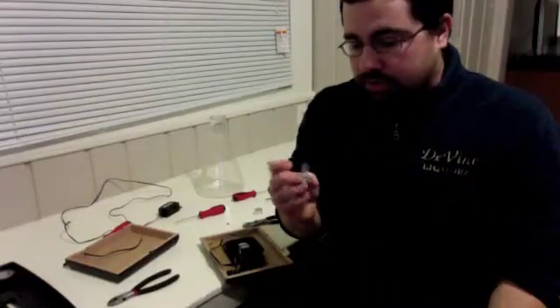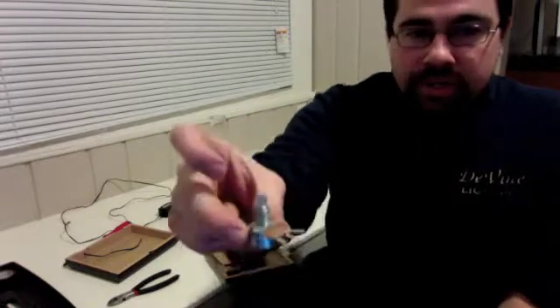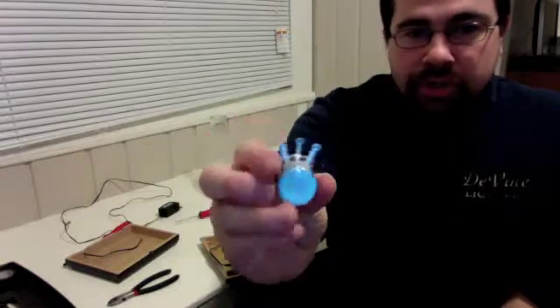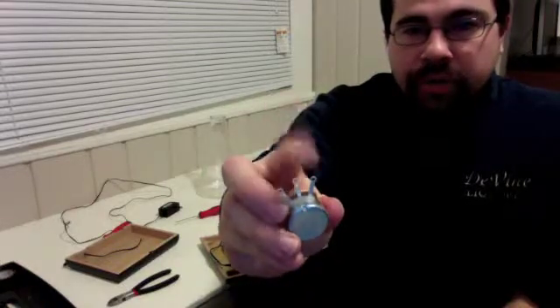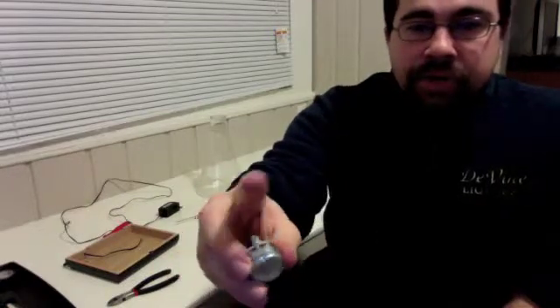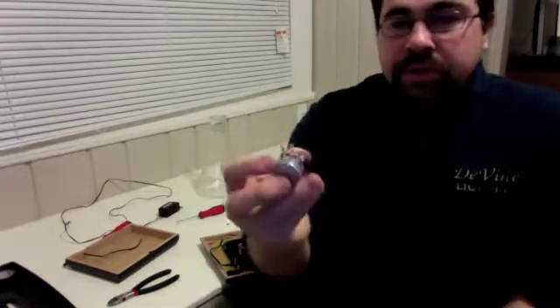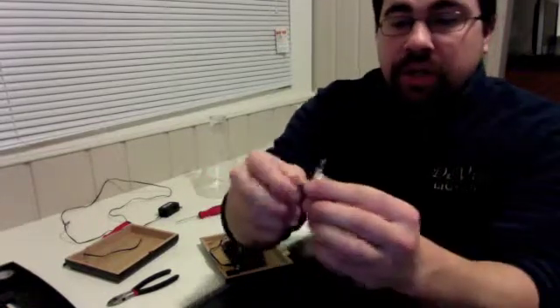Alright, so this is the rheostat, or the potentiometer. What it looks like is this little tower-looking thing with 3 little prongs poking out. Now what you're going to end up doing is choosing the first 2, and you're going to wire through that. The third one isn't going to make a difference. All it does is combining which 2 are going to change which direction means faster and slower, just as long as you're not using the 2 outside ones.